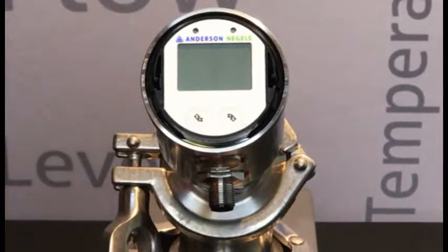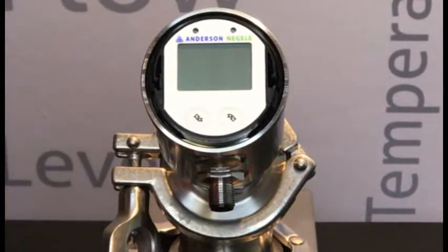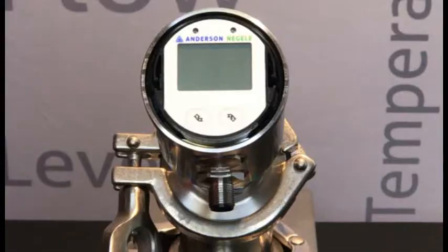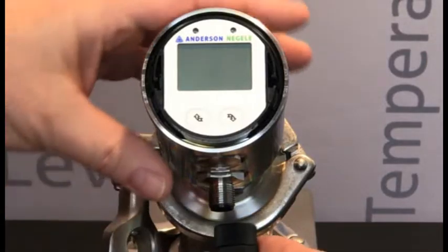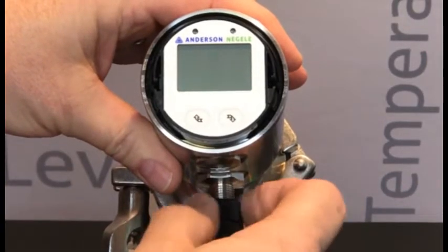This is going to be a short demonstration of the operating menu structure on an ILM-4. To start, we're going to apply power to the device.